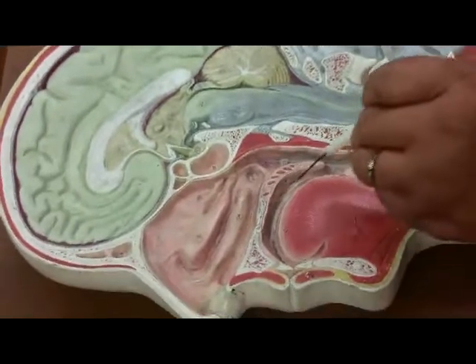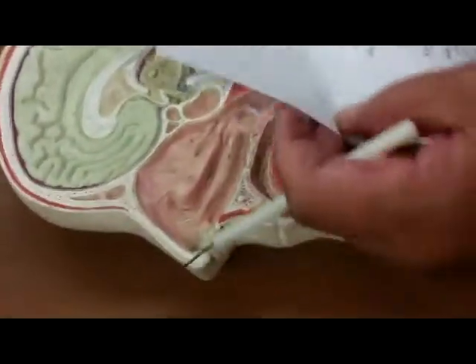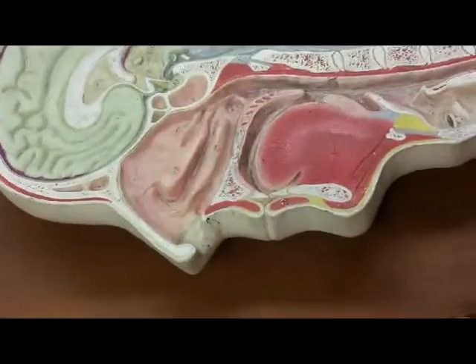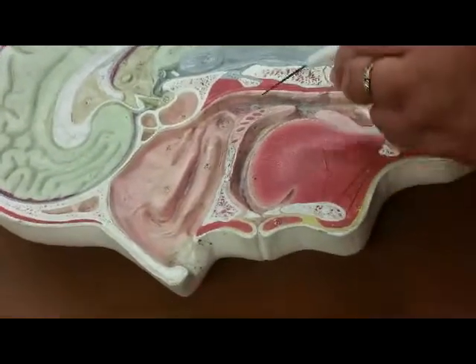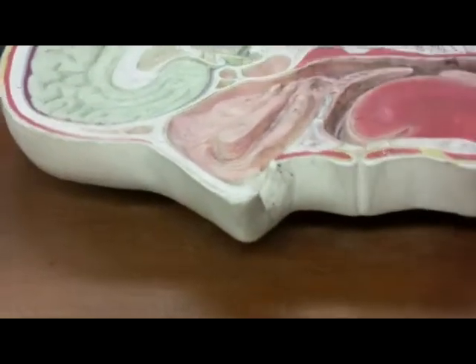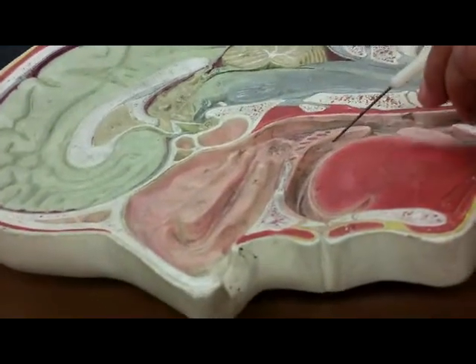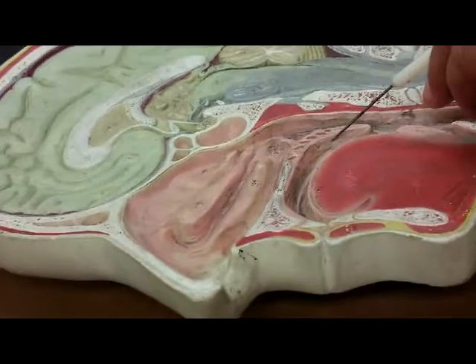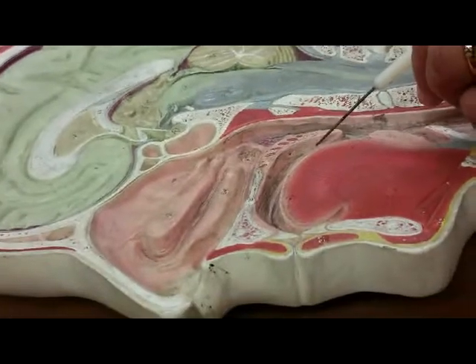Look where the pin is moving, that's the palate. If we turn over to the digestive system, they ask us to give parts of the palate. So we're in the oral cavity. From here, this is the palatine bone, and anything that is under the palatine bone would be the hard palate that I'm touching now. This is skeletal muscle, and so from there to there would be the soft palate. And this V-shaped structure is the uvula.